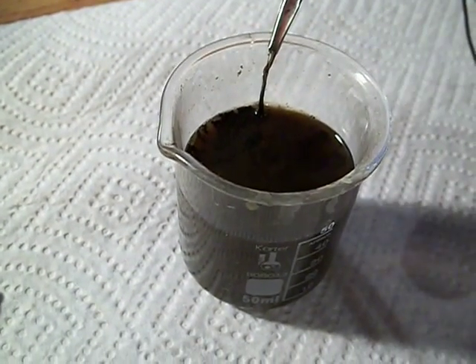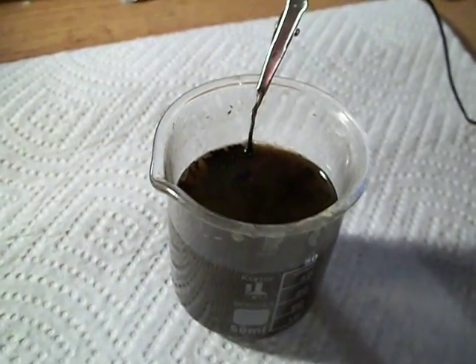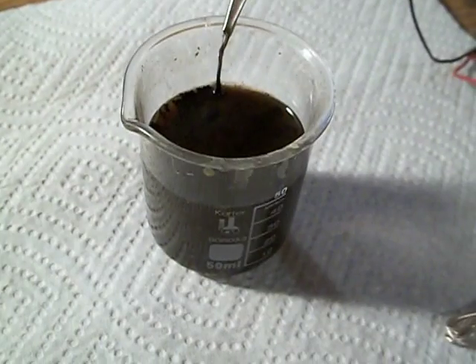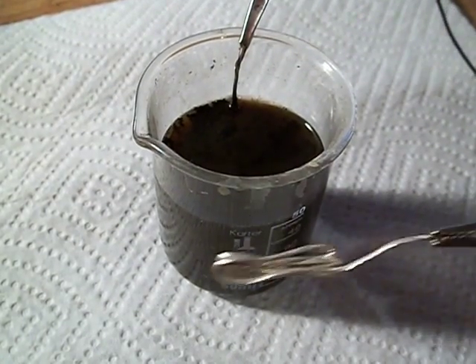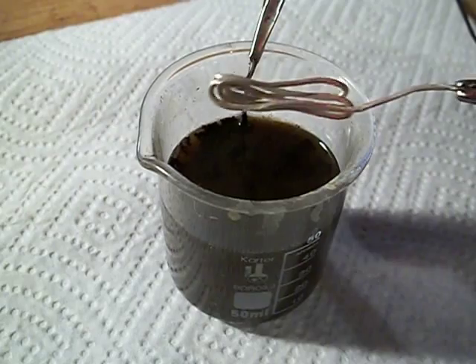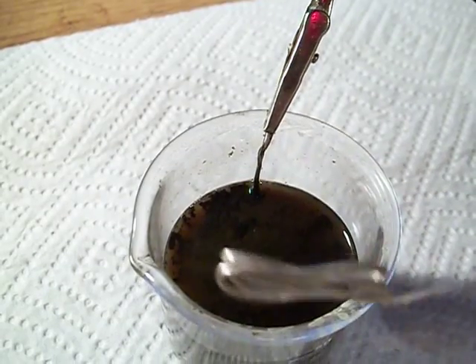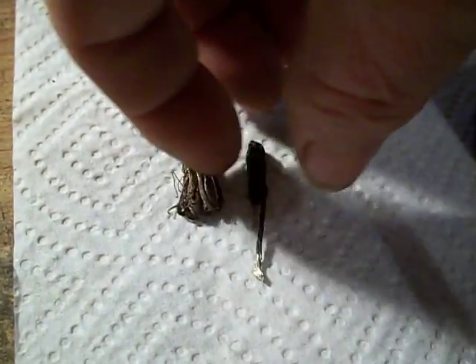Even though the process is basically the same for stripping silver with the thiosulfate solution, I found that adding just a little electricity kind of juiced things up. So what I've done is I've set up just a real small little cell type thing going on here. I've got a piece of this silver-coated copper wire, and I'm using a piece back here for the cathode, and I've already run a couple of pieces through here.